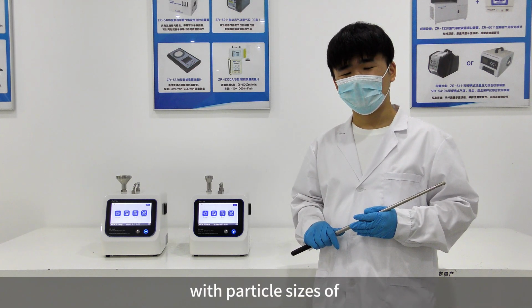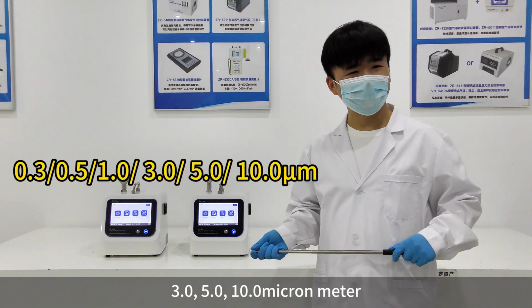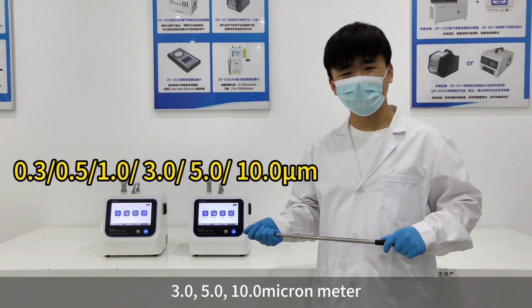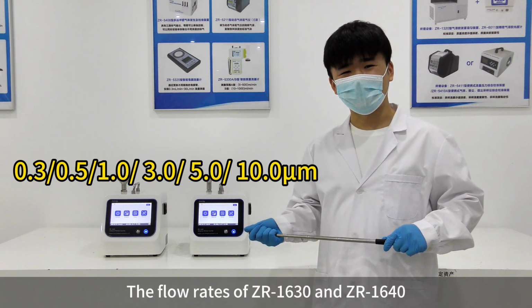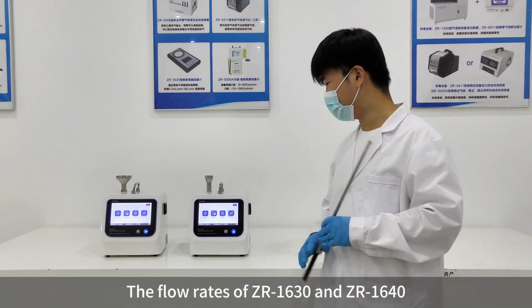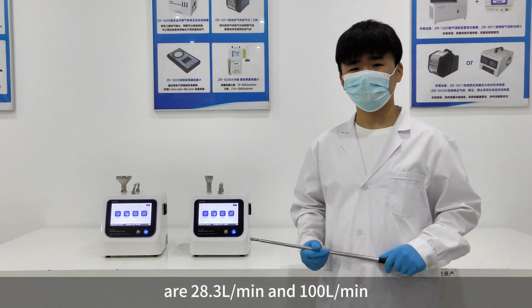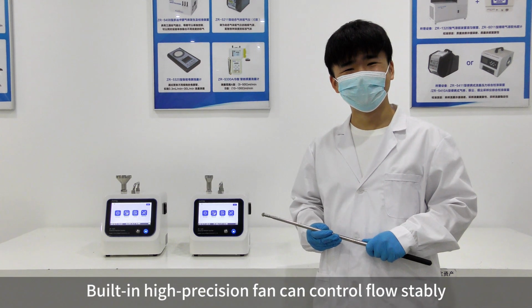There are 6 channels to collect particles, with particle sizes of 0.3, 0.5, 1, 3, 5, 10 micrometers. The flow rates of ZR1630 and ZR1640 are 28.3 LPM and 100 LPM. The built-in high-precision fan can control flow stably.